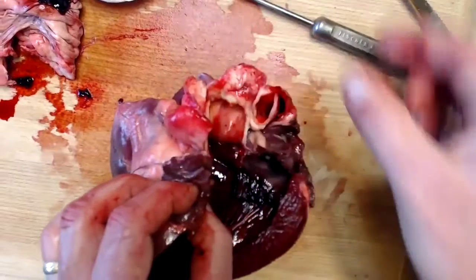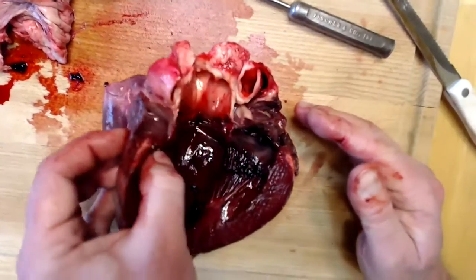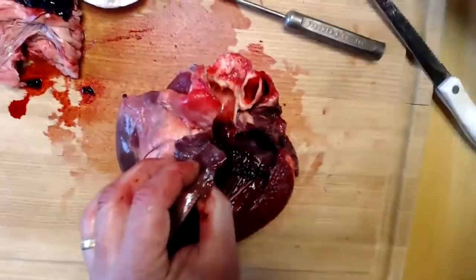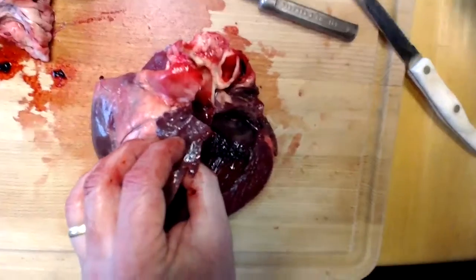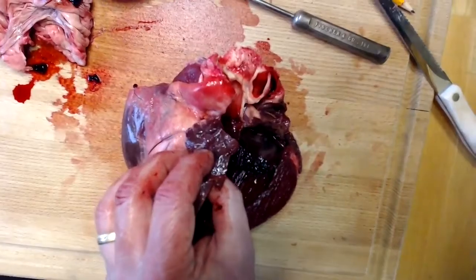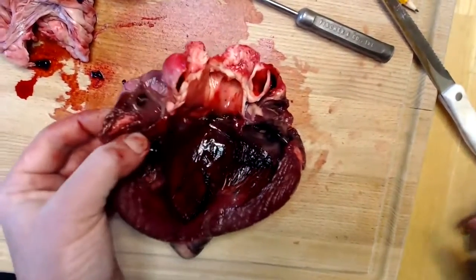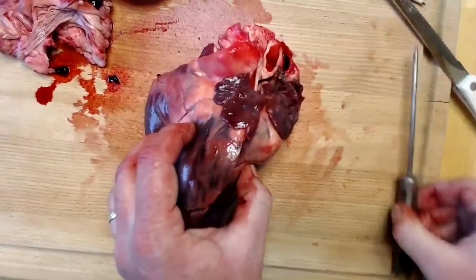We don't see the arch of the aorta here because, again, it's been cut in such a way to prevent us from seeing that arch. But there will be branches that branch off of the heart. Again, you might remember from chapter 15 that we've got several branches coming off of the arch of the aorta. And that pretty much is the dissection.